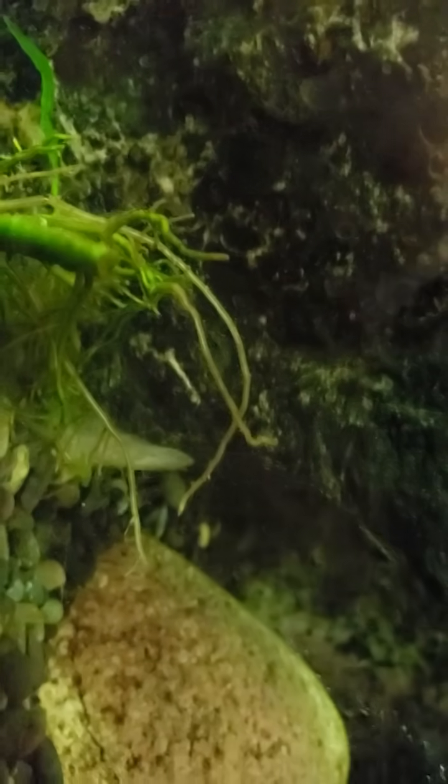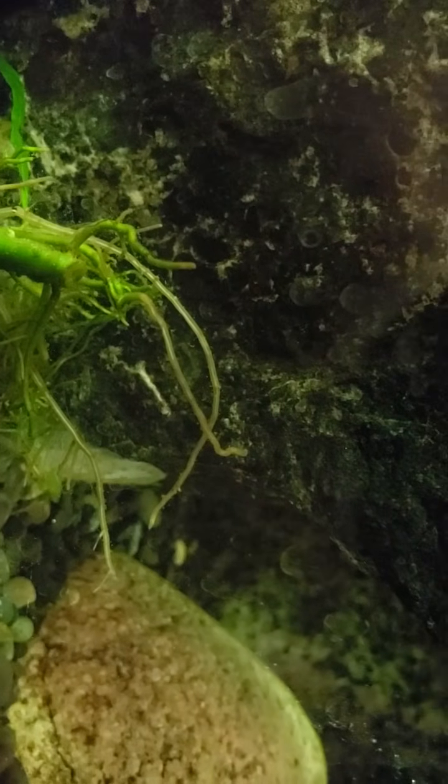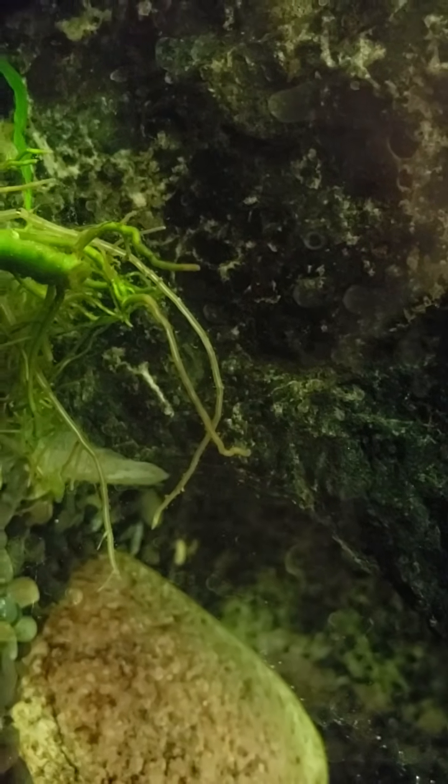The super strong currents up here come down, settle down through here, come under all these branches and things, and then very slowly, almost in a siphoning manner, it drifts through here. And I think this 1-inch gap between the glass and the stone that was taken out of a river probably had some of those gemmules on it, and that is what turned into the start of this colony.